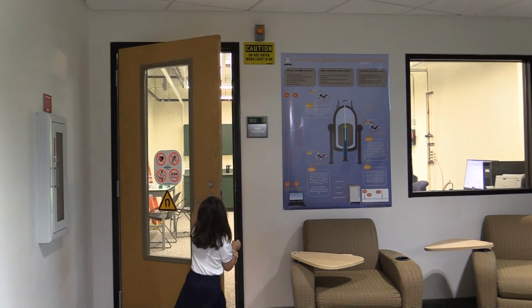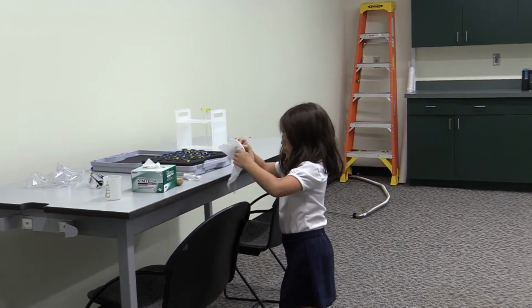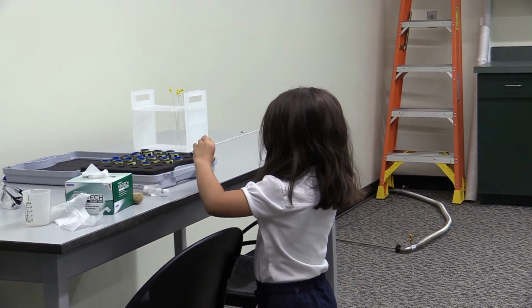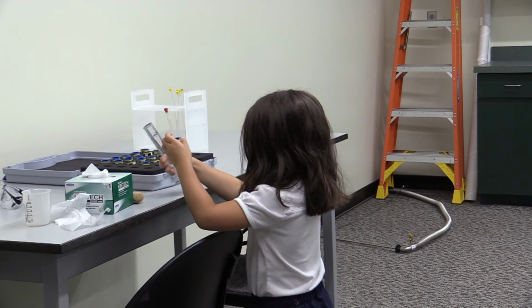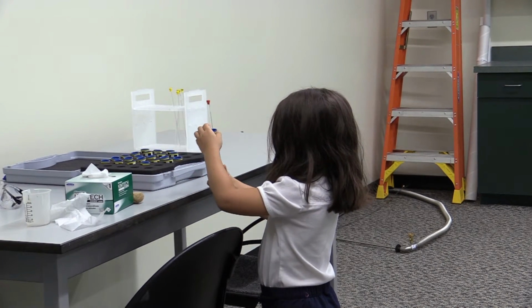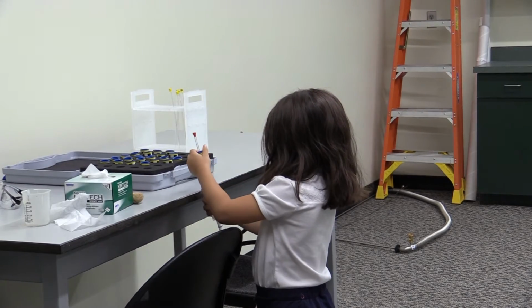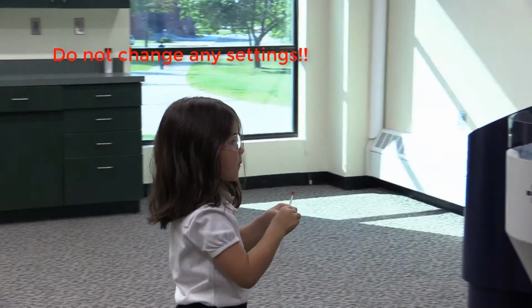When you come into the NMR instrument room, there will be a table to your left. Wipe the outside of the tube with a Kim wipe to get rid of oils and fingerprints on the tube. Place your sample in a blue spinner. You will then place the blue holder into the clear NMR tube gauge to ensure your sample is at the correct height. Push the tube down as far as it will go. Do not change any settings on the NMR tube gauge.